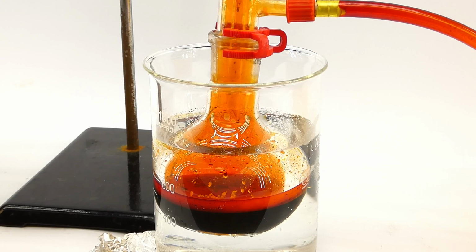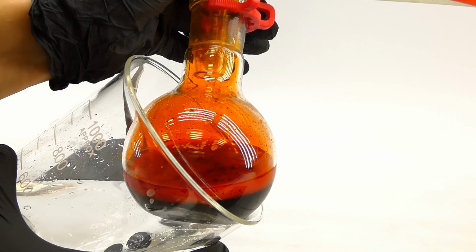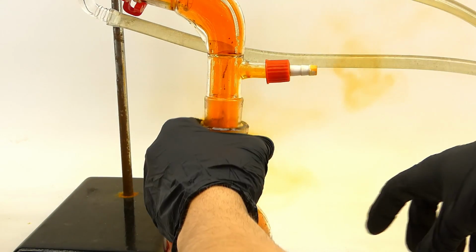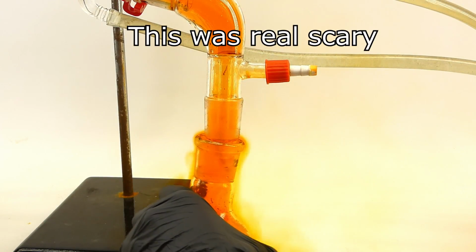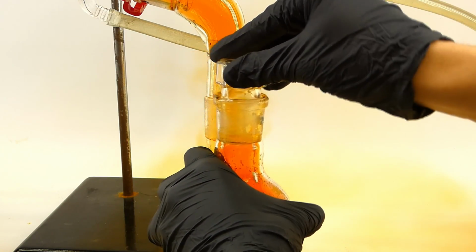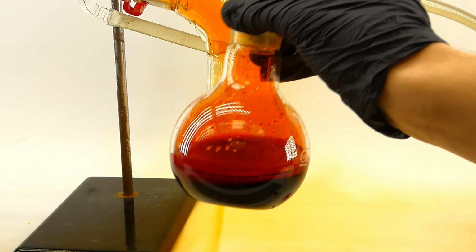In the receiving flask, there was a really nice amount of bromine, which I felt was good enough, so I let everything cool down and started disassembling the apparatus. A ton of bromine vapor escaped from it, but it was thankfully quickly picked up by my fume hood, and in the end, I was left with a good amount of some impure bromine.